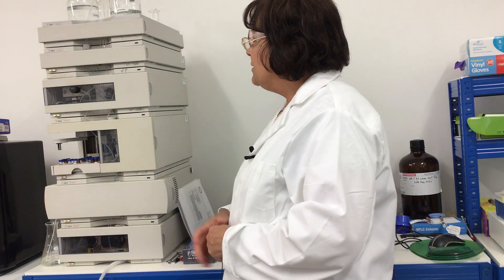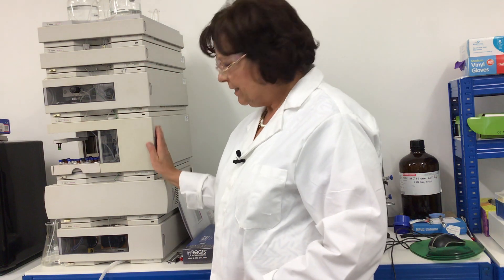Hi, my name is Clara Valko and I will demonstrate how to start up an Agilent HPLC and ChemStation instrument located in my laboratory at Biomimetic Chromatography Limited in Stevenage, United Kingdom. This is an Agilent HPLC instrument. HPLC stands for High Performance Liquid Chromatography, which is a separation method where we can separate components in a mixture using a chromatographic system containing a stationary phase and a mobile phase.